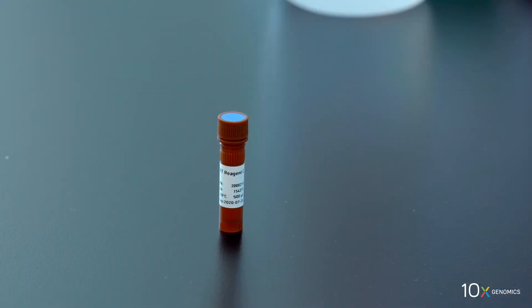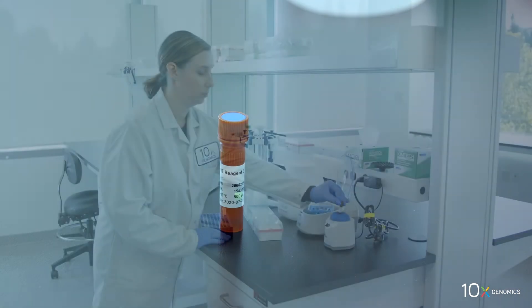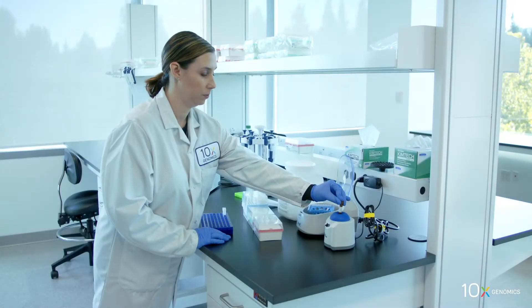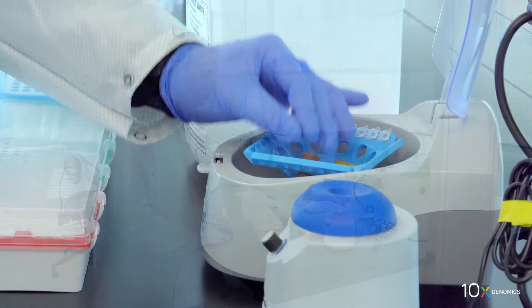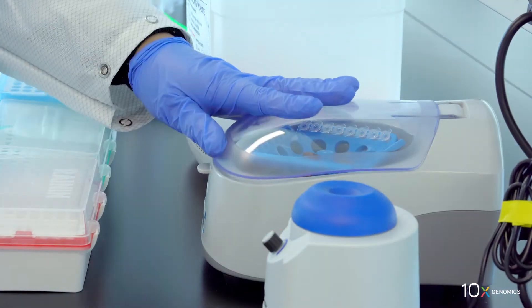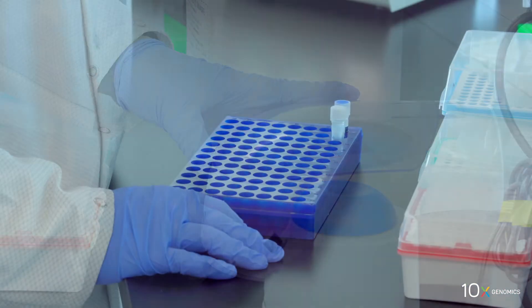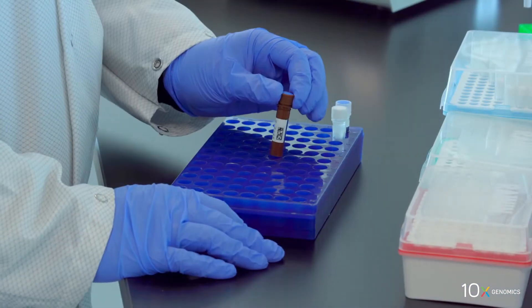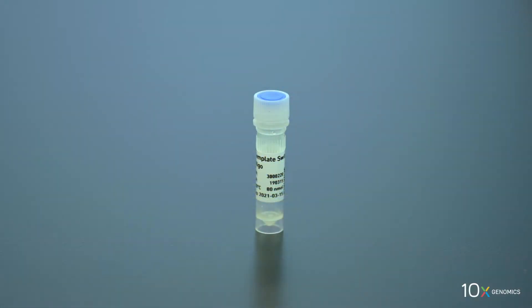First, we will prepare the reagents. We have RT Reagent C. Thaw, vortex, spin down briefly, and equilibrate to room temperature.